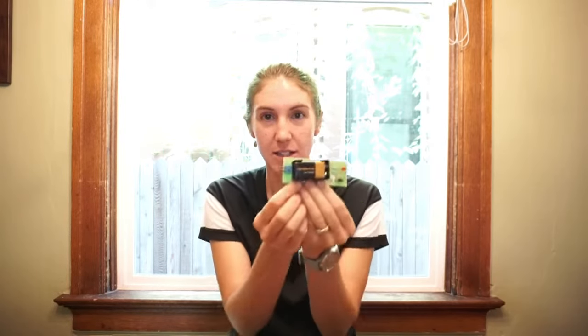We're going to be testing their luster, so you're going to look to see if they're shiny or not. We're going to be testing their malleability, that's whether or not we can bend them, or if they're very brittle. And then we're going to be testing conductivity. In order to do that, we're going to be using this conductivity tester here, where it will light up if something is conducting electricity because it completes a circuit. Last but not least, we're going to be testing whether or not these different elements are magnetic. So I have a little magnet here that we're going to be testing it with.